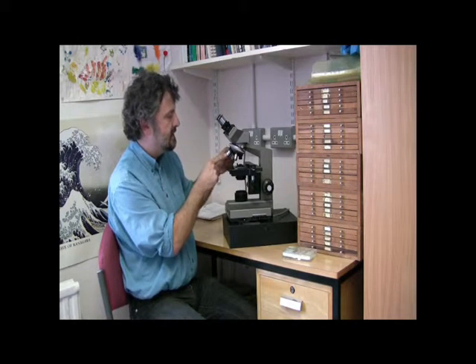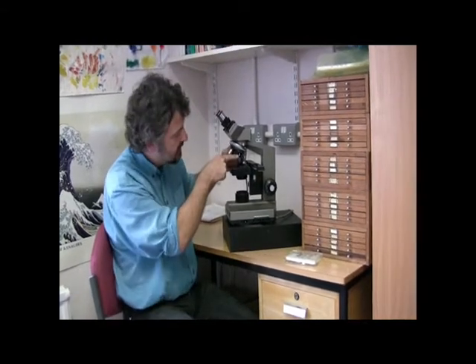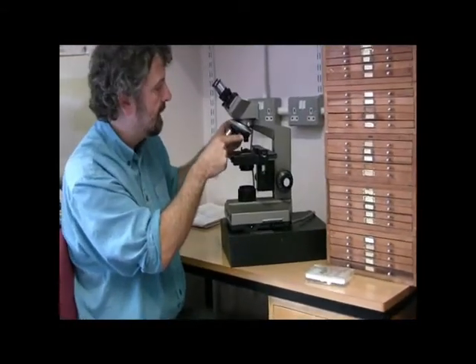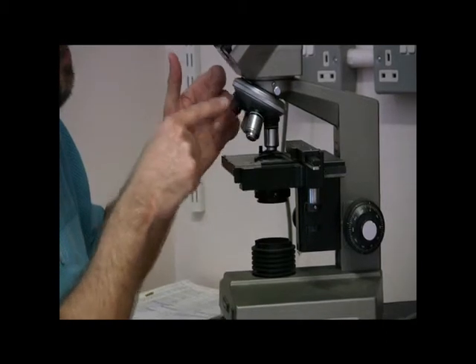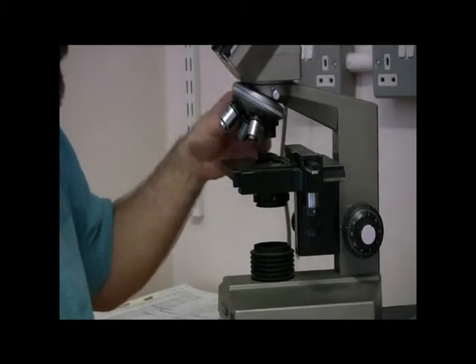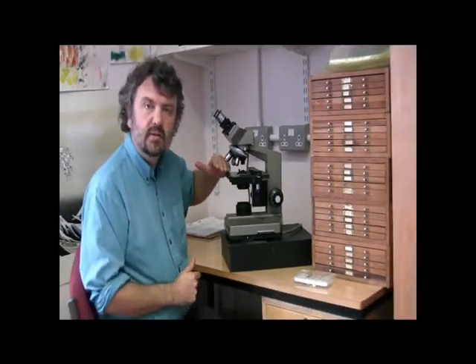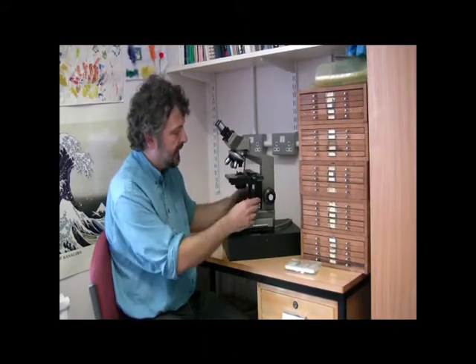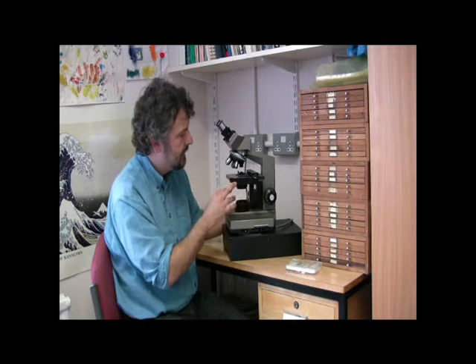Underneath that we have the lenses, the objectives of the microscope. Quite often there's more than one of different magnifications. The shortest one is usually the lowest magnification, which in this case is a times 4. Then we've got a times 10 and so on, right the way up to the largest one which is a times 100. You can see that they rotate on this rotating hinge here. Below that we have the microscope stage — this is where you put the microscope slide. You've got these dials here which enable you to move the microscope slide around the stage, and there are rulers on here which enable you to record where you've been on the stage.